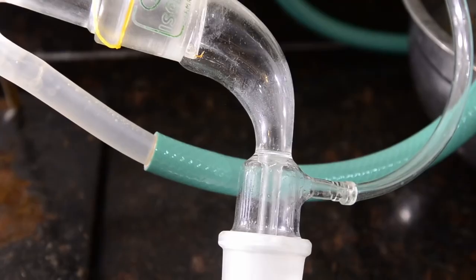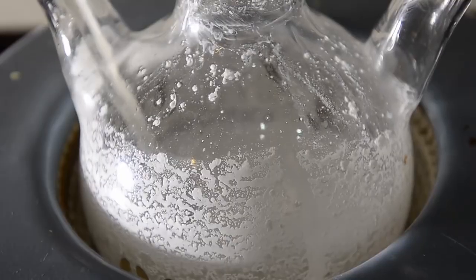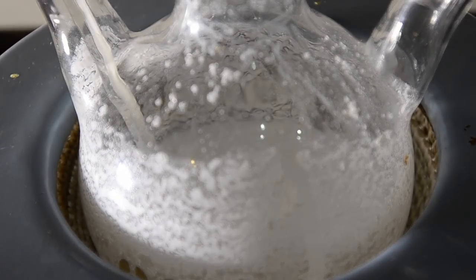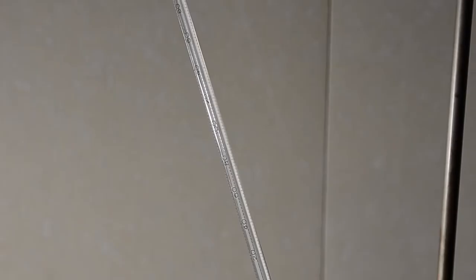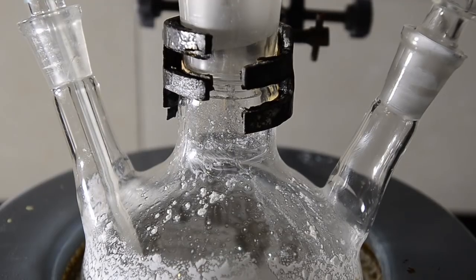The first sign of liquid boiling is around 110 degrees C. Since our sodium acetate is unlikely to be 100% dry, there will almost certainly be some acetic acid present in our mixture.